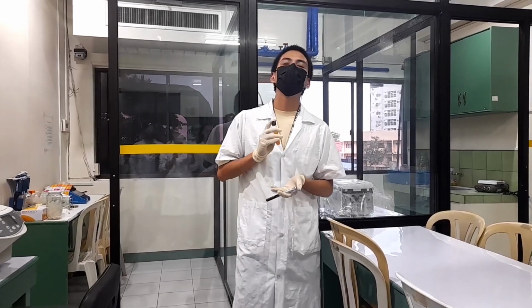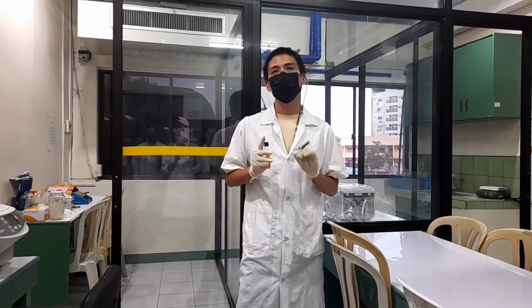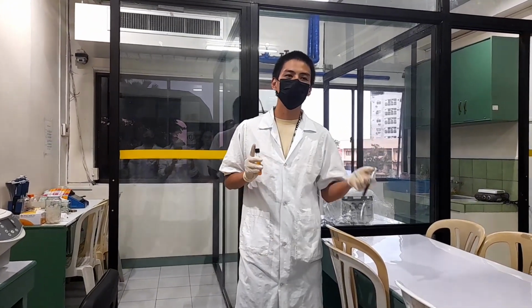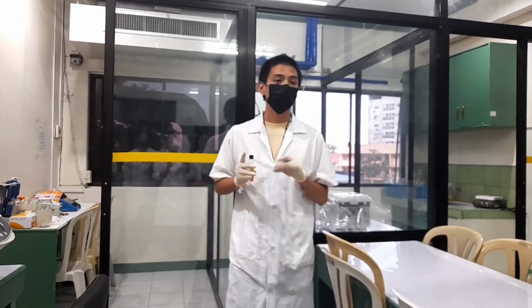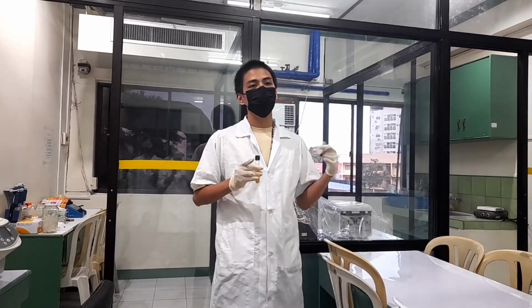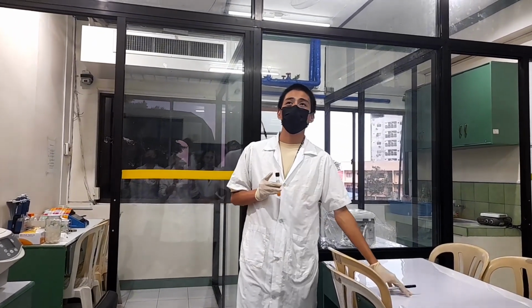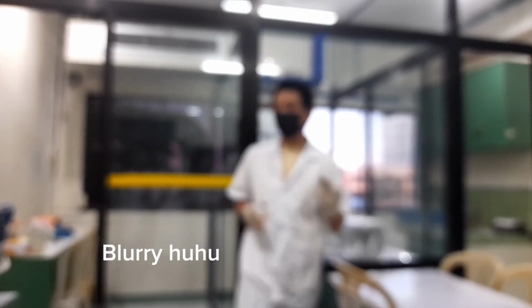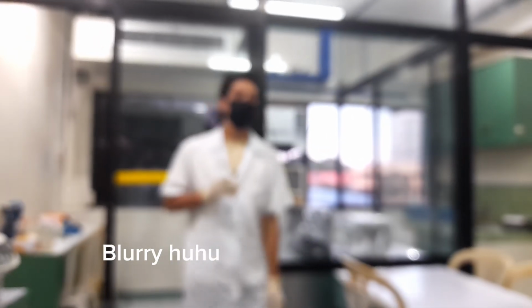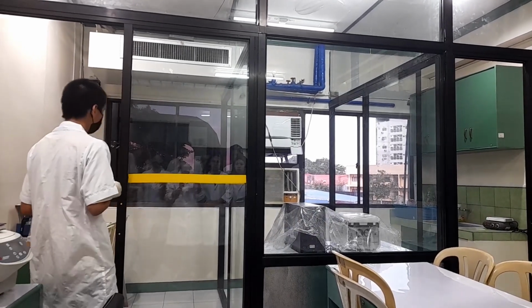And the turbidity and the OD600 tell us the concentration of the bacteria. So we need to dilute it depending on the further methods that we're going to use for DNA extraction. For example, there's a specific concentration that we need in order to collect our DNA. For the DNA, we need 5 to 10 to the 9 cells to collect in order to have visible DNA extraction. So that would be a reading of 1 to 2 in our OD600.